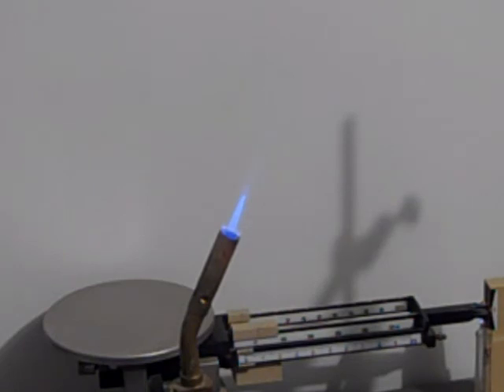That's it. So you should have your colors demonstrated here anyhow. Calcium, the orange color is the calcium.